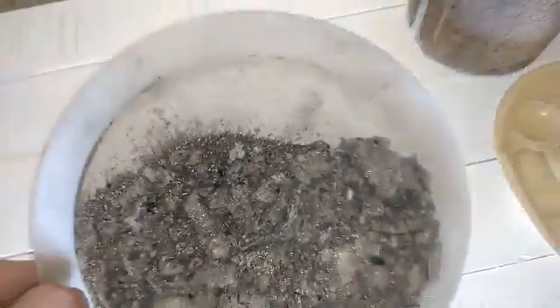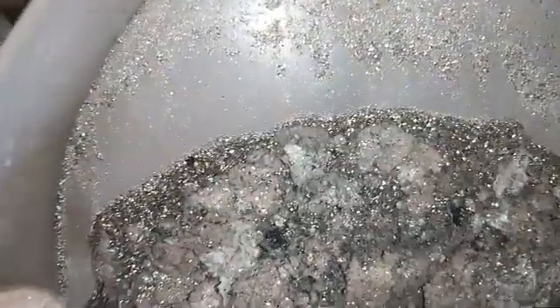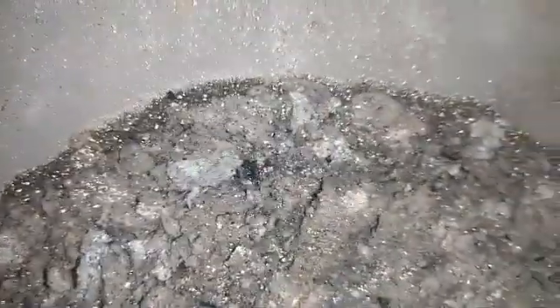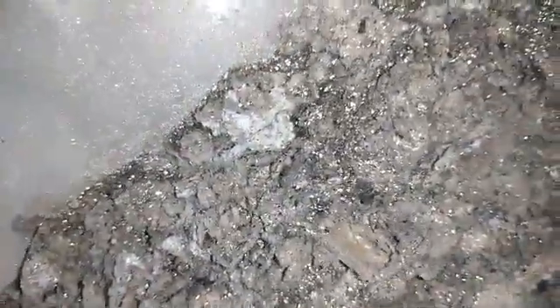So this test is just for you to know what to collect and what not. You collect the substrate in the middle, but not the isolation. Isolation is just worthless — there is no noble metal in the isolation, there is some metal, maybe titanium, I don't know. Some foils that don't dissolve in aqua regia, nothing, any acid. But it's not noble metal, definitely. So the stuff goes to the container.